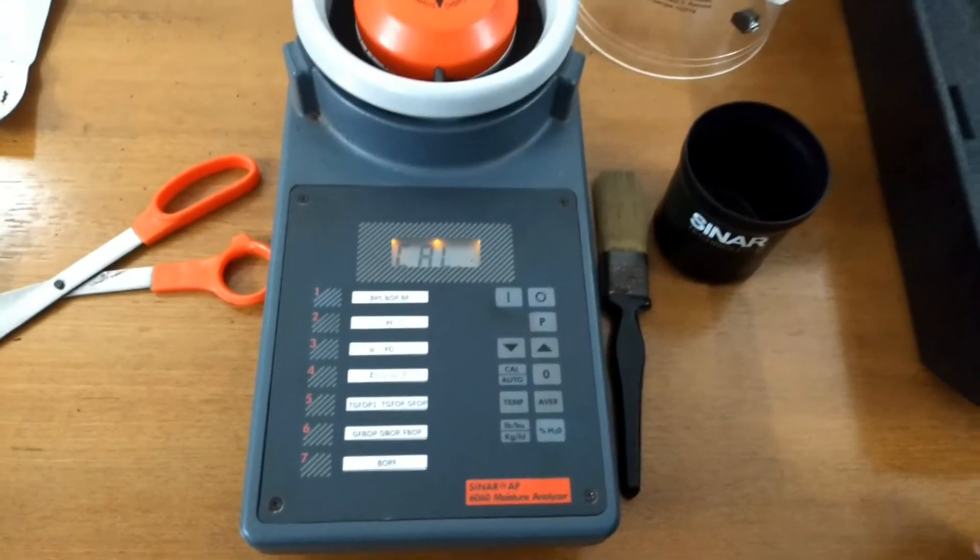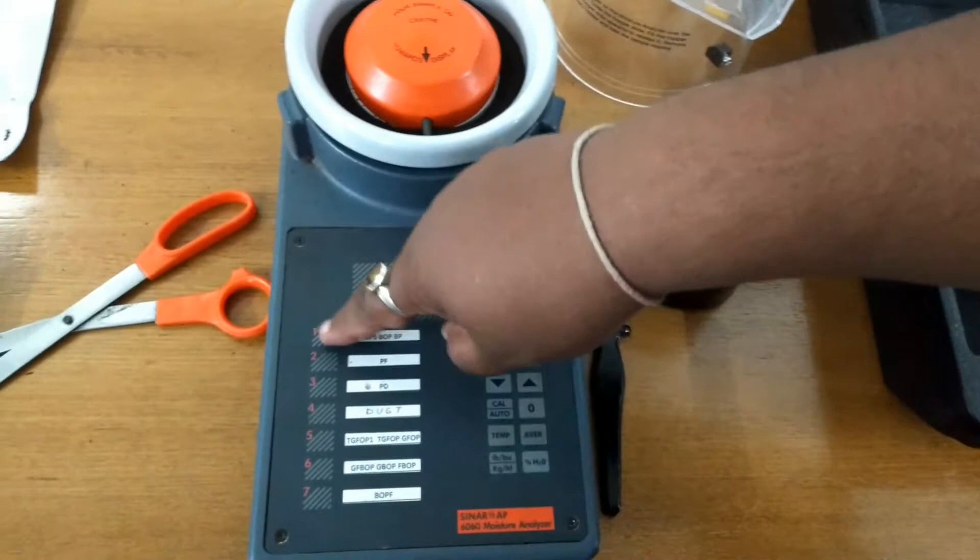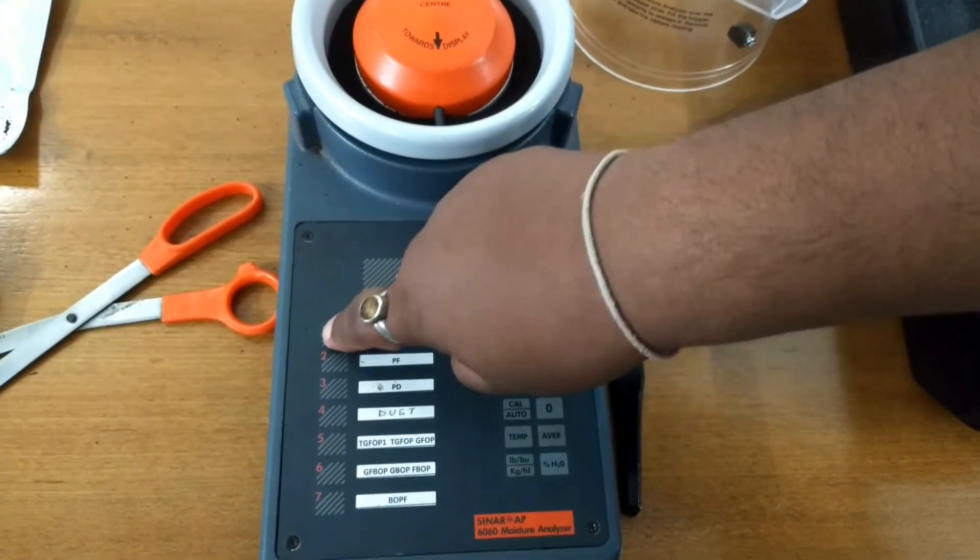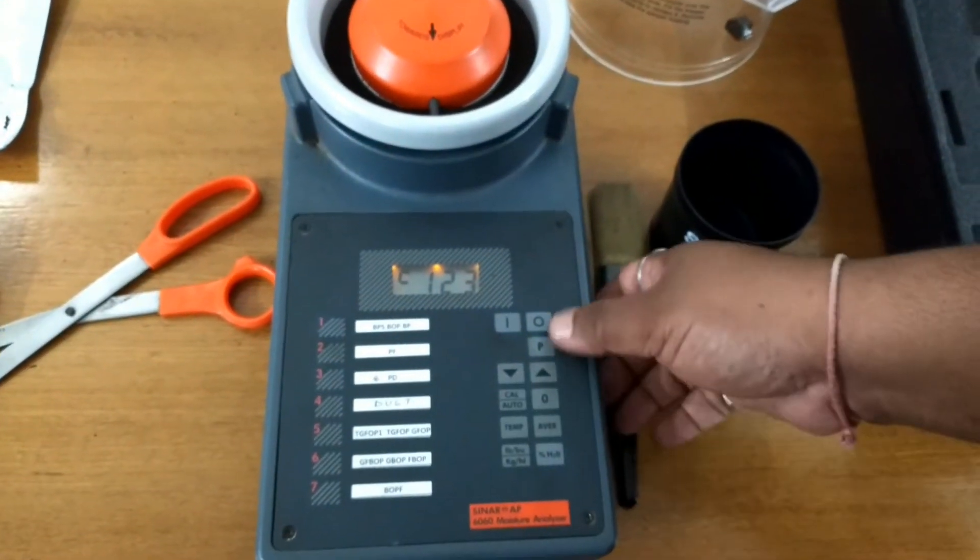Press the password. The password is 123. In few machines it is 226. Now, do a long press of P.